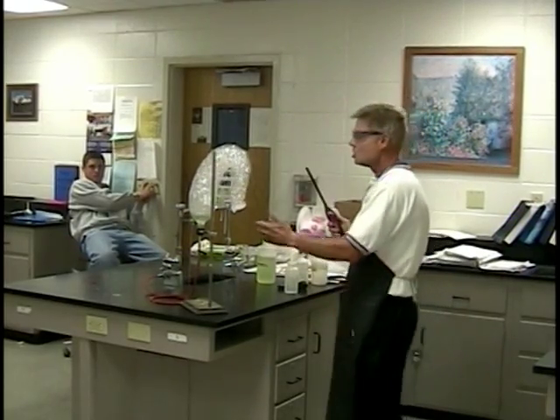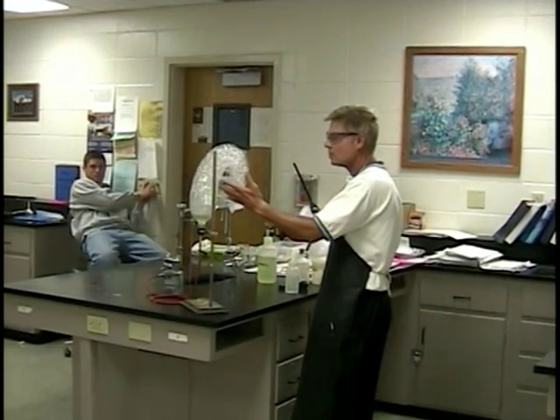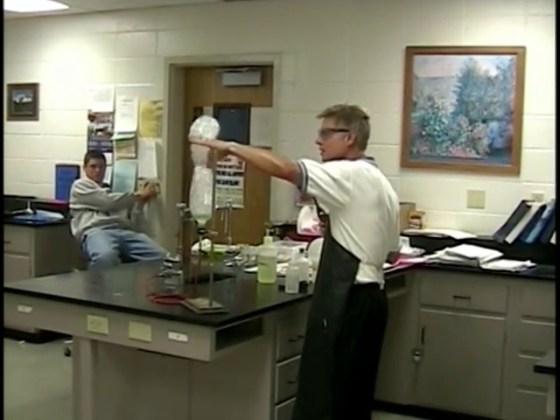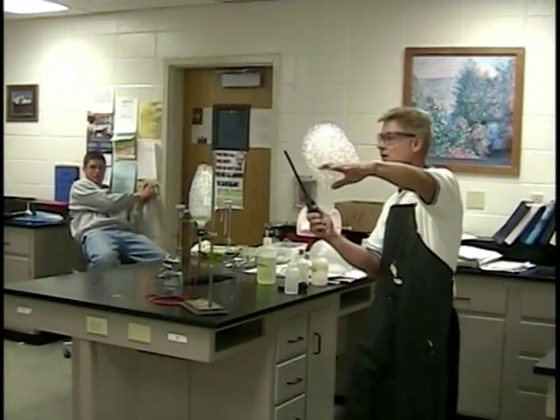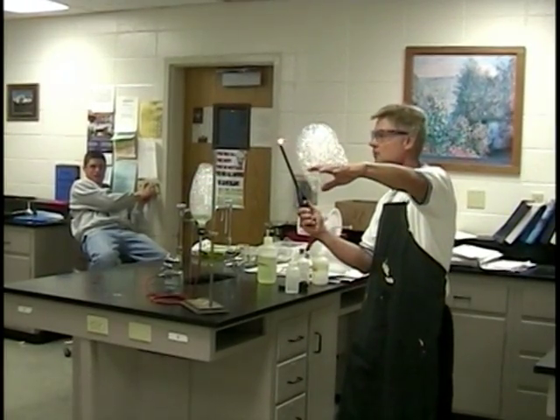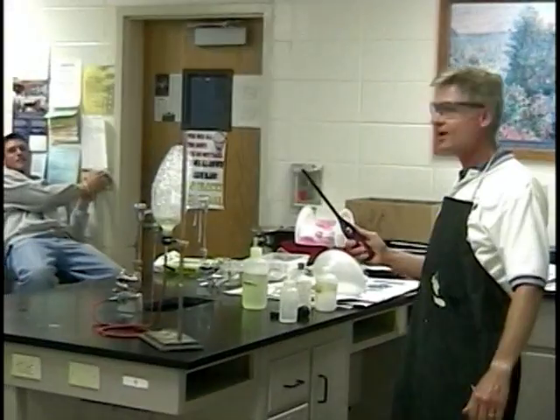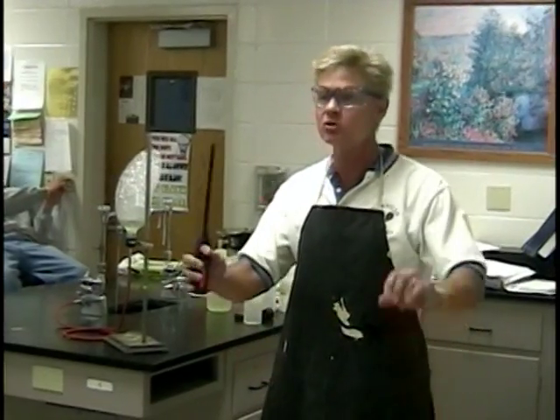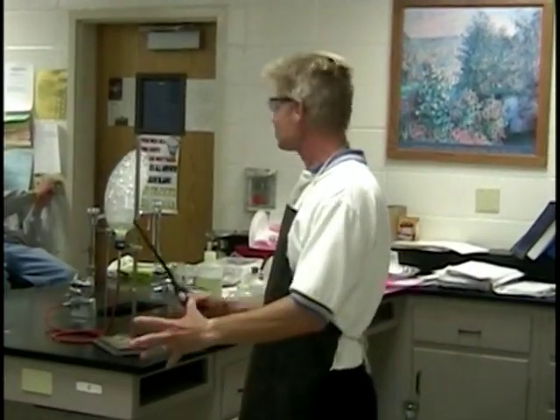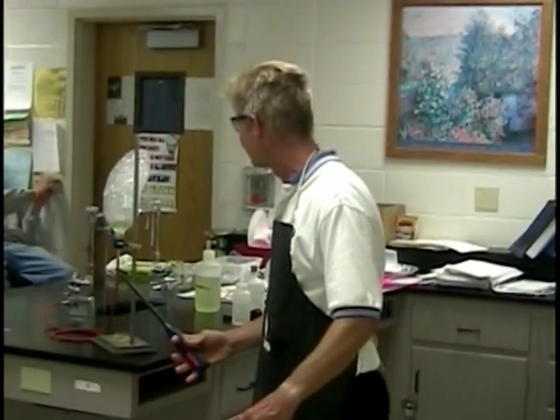Let's make sure my little torch is going to work. Let's take a little methane and do another experiment here. Are you ready? Wow! Can you believe that? That is called a combustion reaction. We took methane, which is a CH4 molecule.